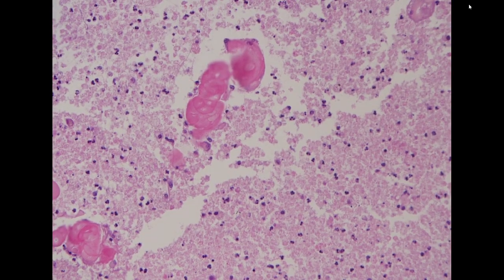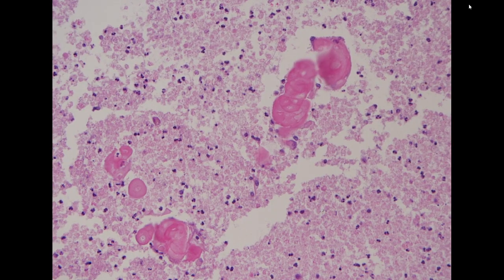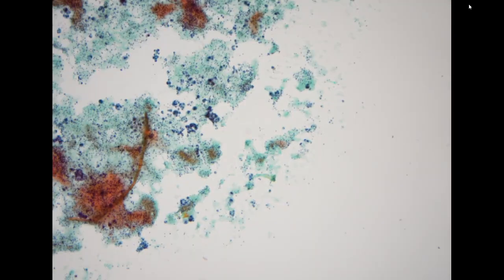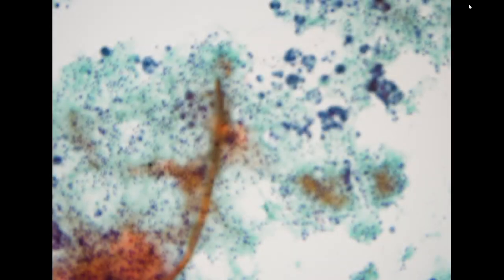Plus, the clinician didn't have any surgical specimen for us because he already received the gamma knife surgery. They say surgery, but actually it's just a radiation treatment, which I'm not a very big fan of. So we should give the specific pathologic diagnosis, which is adamantinomatous craniopharyngioma. The next specimen is an ascites specimen.